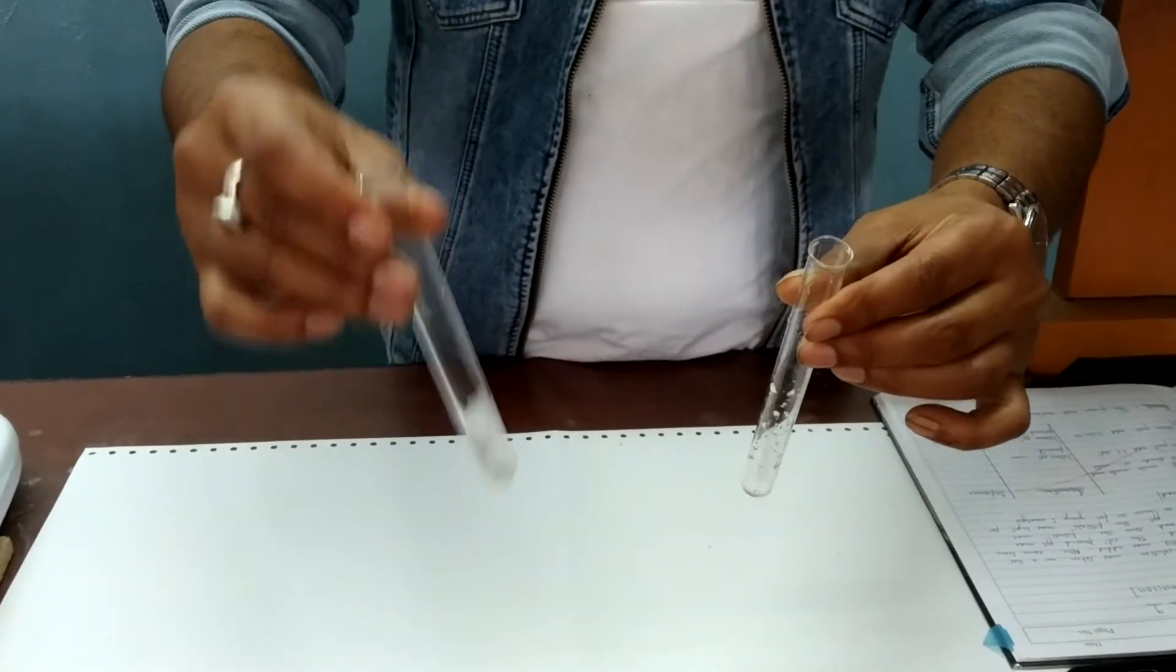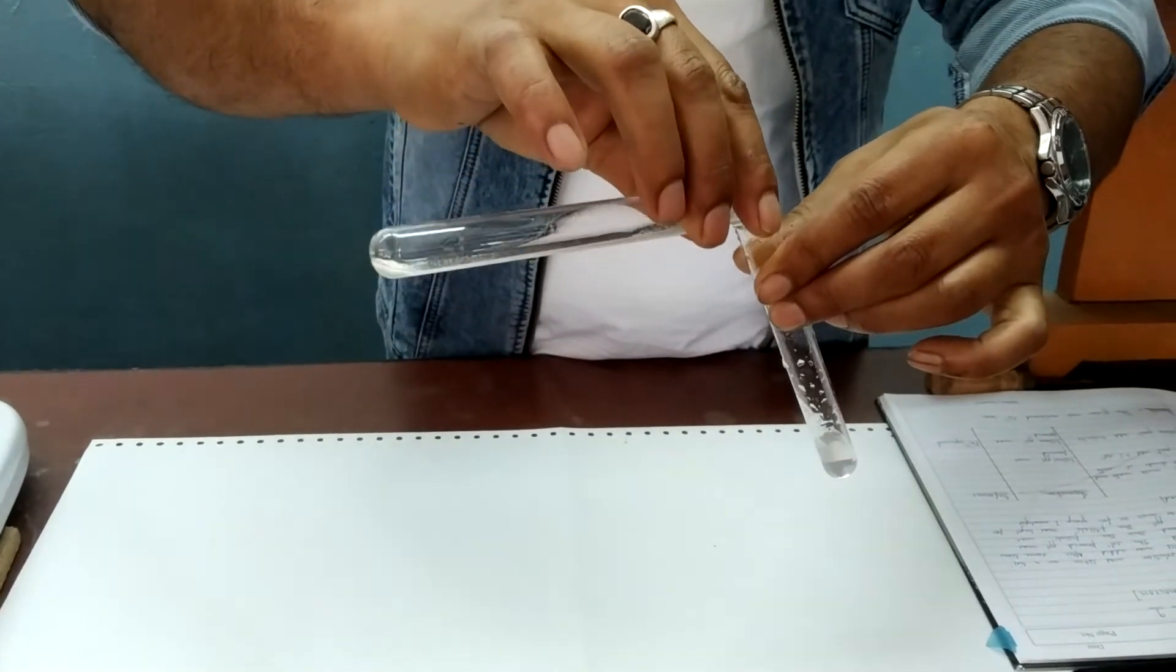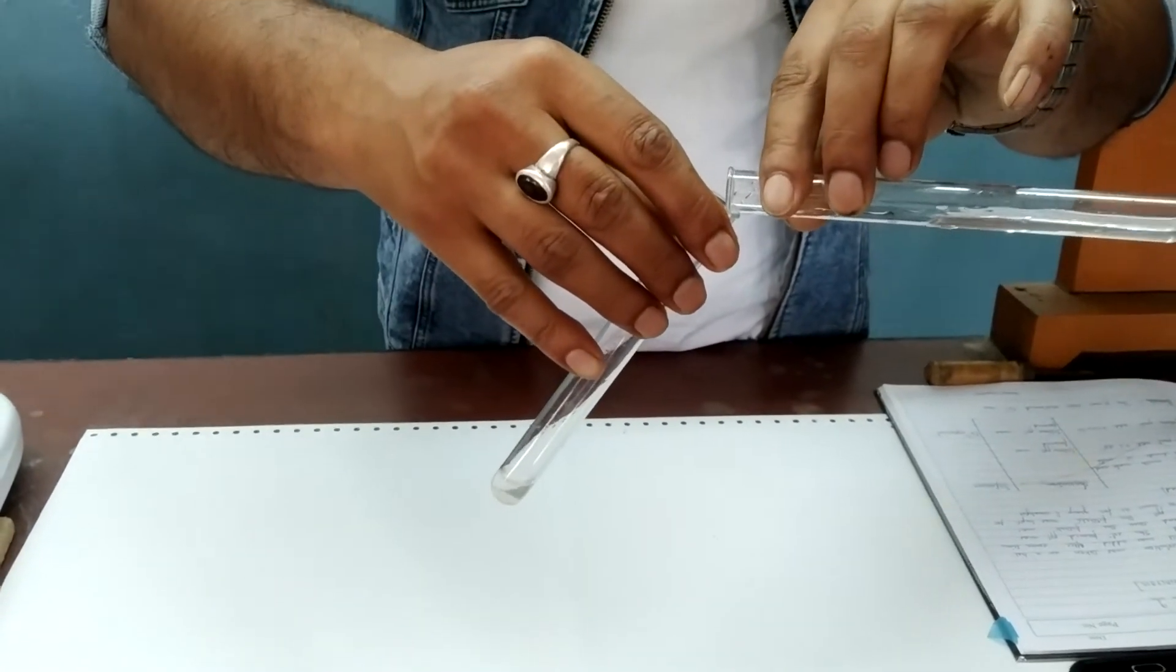Now we will separate this PPT and we divide this into two parts. We need to perform two tests. For that we require two parts.